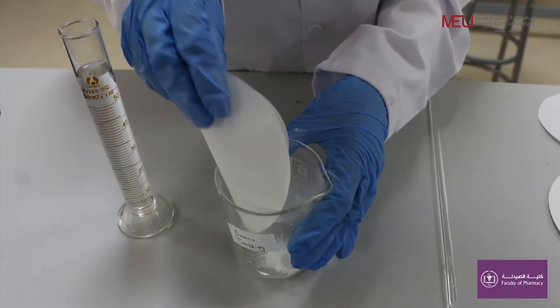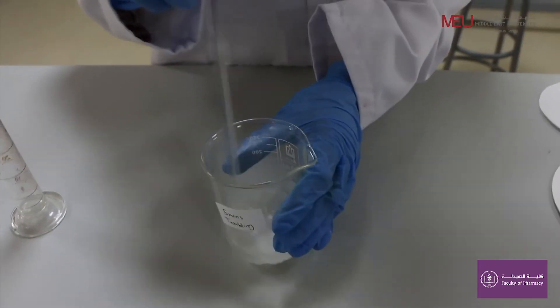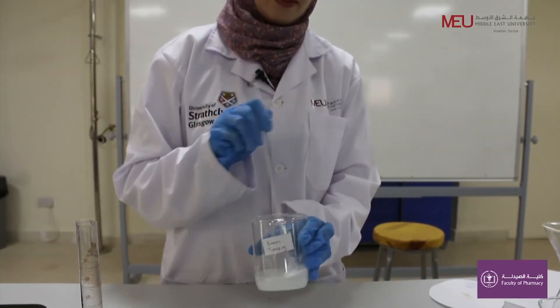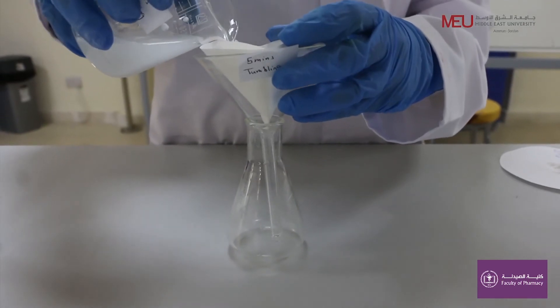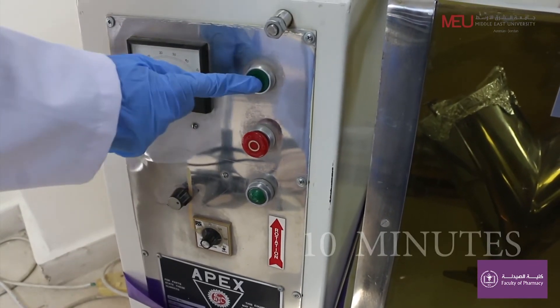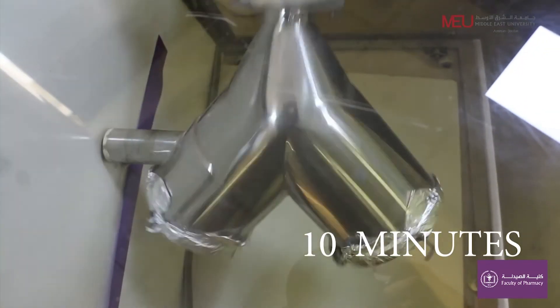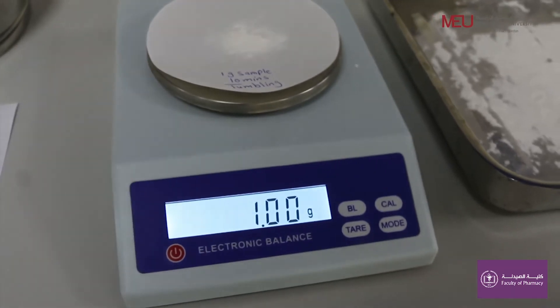Dissolve the sample in water. The insoluble powder talc will stay on the filter paper. Continue mixing for another five minutes, for a total of ten minutes. Take another one-gram sample from the mixture and repeat the steps again.